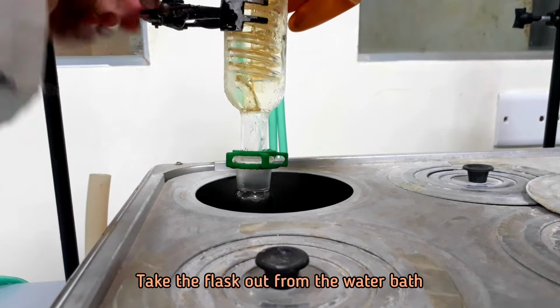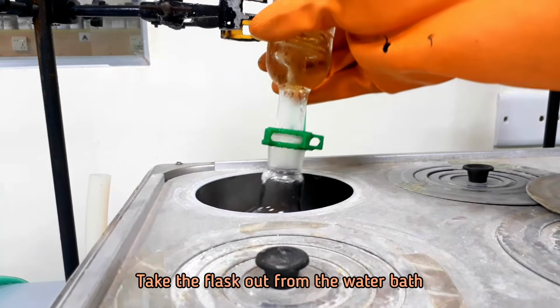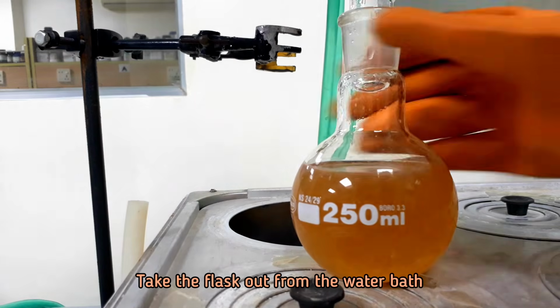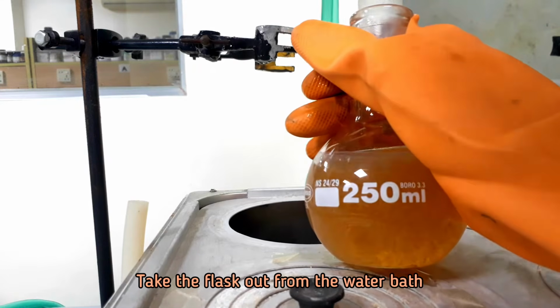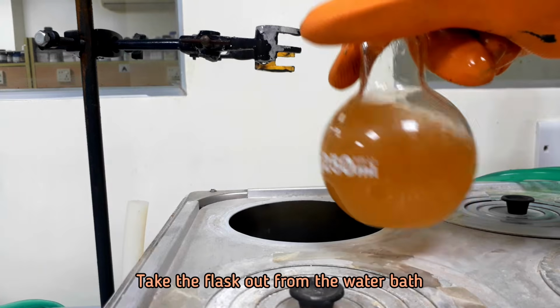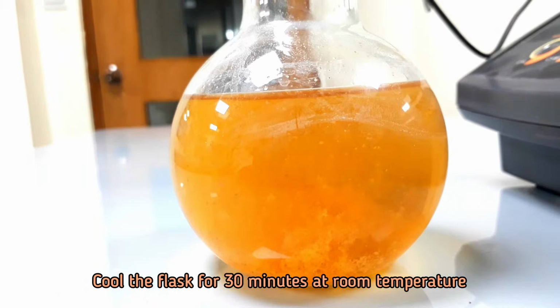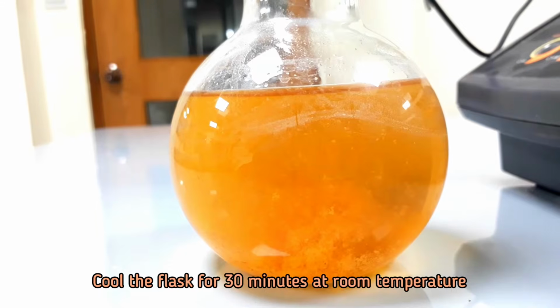After 30 minutes of boiling, take the flask out from the water bath. Cool the flask for 30 minutes at room temperature.